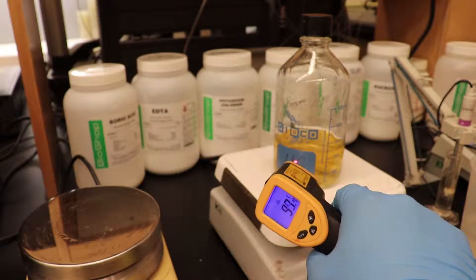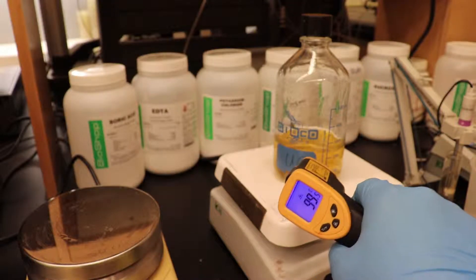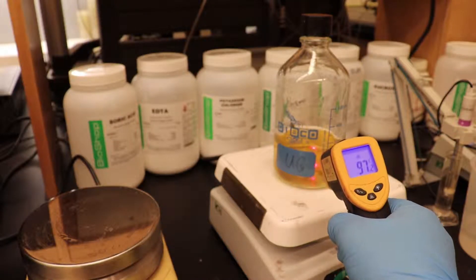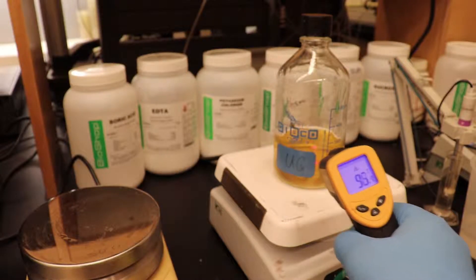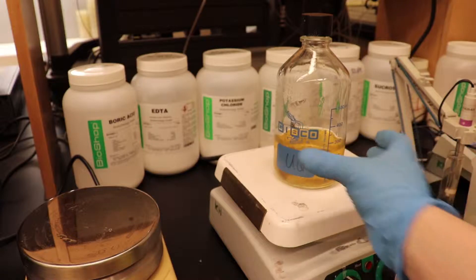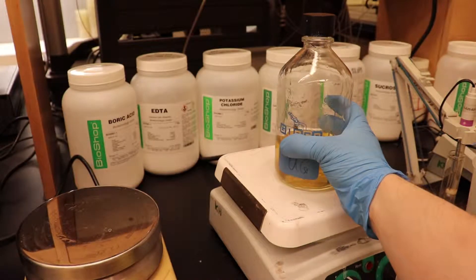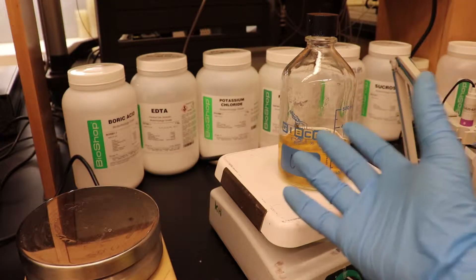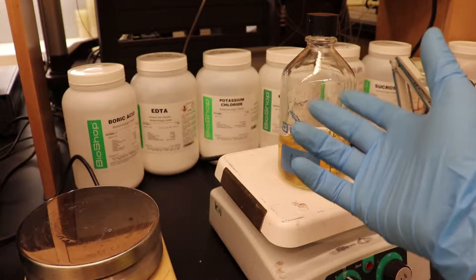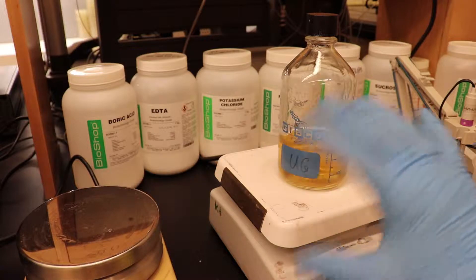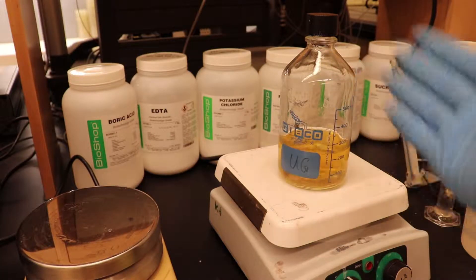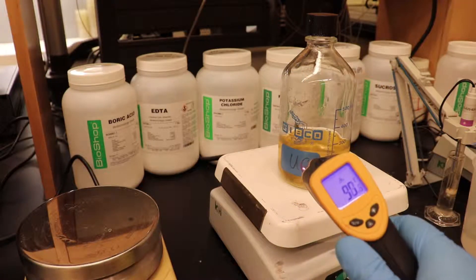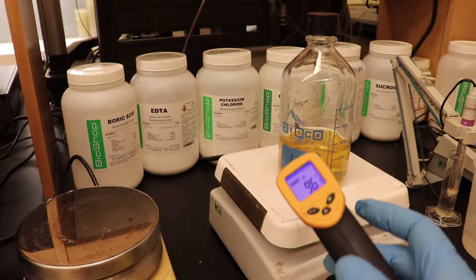So we're at about 100, you know, 98, 99, 100 on that label. And then on the glass we're about 97, 92, 95. So it's a much better way, rather than, you know, the old school method is if you can still hold the bottle, then you're ready to add your antibiotics. I have quite a big tolerance for heat or high tolerance for heat. So for different people, you may be adding antibiotics at different times. Whereas with one of these guys, you can just wait until it gets to, you know, 60, 65 degrees C and add your antibiotic.